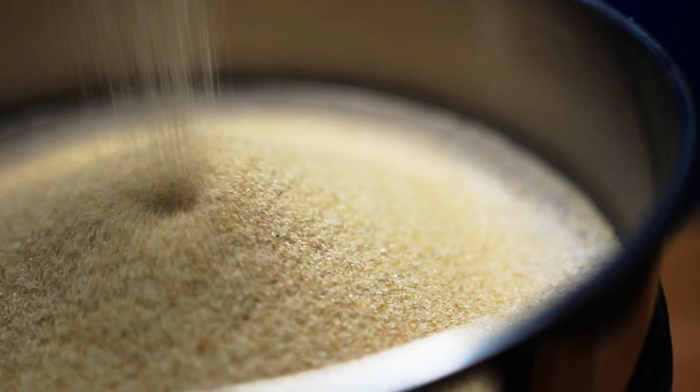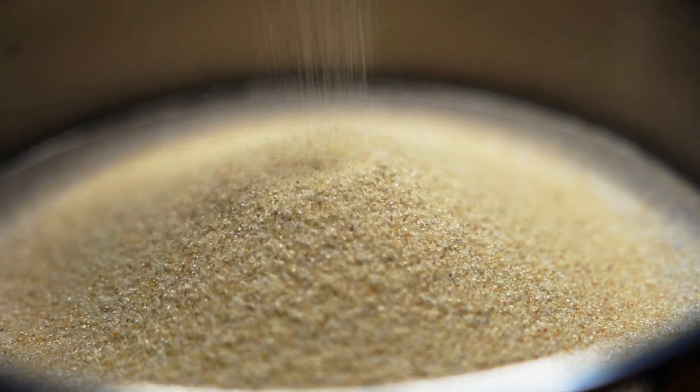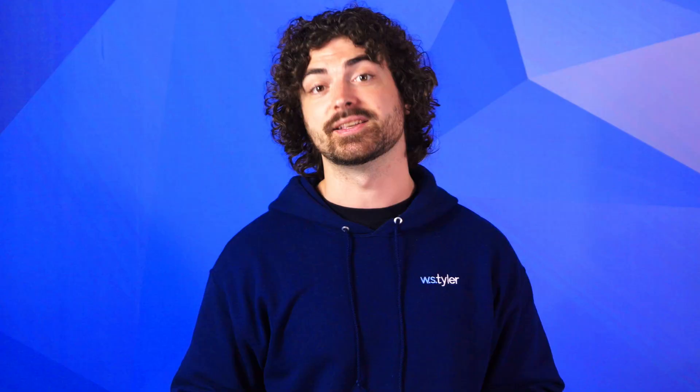To put this all into perspective: obtaining the weight of your representative sample is the starting point of any test sieve analysis and dictates the accuracy of your final particle analysis results. After the sample weight is recorded, you must run the sample through a sieve stack to generate a reliable distribution curve — this is where having the correct sieve size is everything. When weighing the material retained on each sieve, each fraction should ultimately add back up to the original sample weight and provide a true overview of your production line.